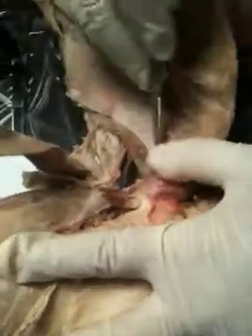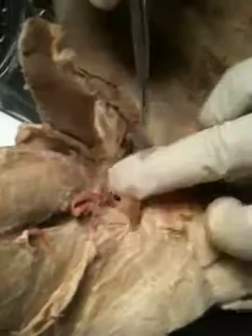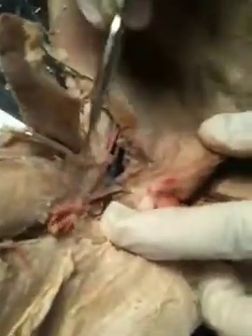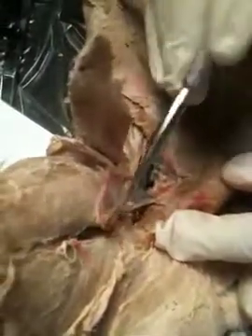External right here. External iliac vein there. And then that Y's off into the femoral vein. Wait, you forgot the internal. Oh, okay, we forgot the internal. There's the external iliac vein and the internal iliac vein. And from the external iliac vein, there is a Y that goes into the femoral vein, which branches out, and the other part, the deep part, turns into the deep femoral vein.